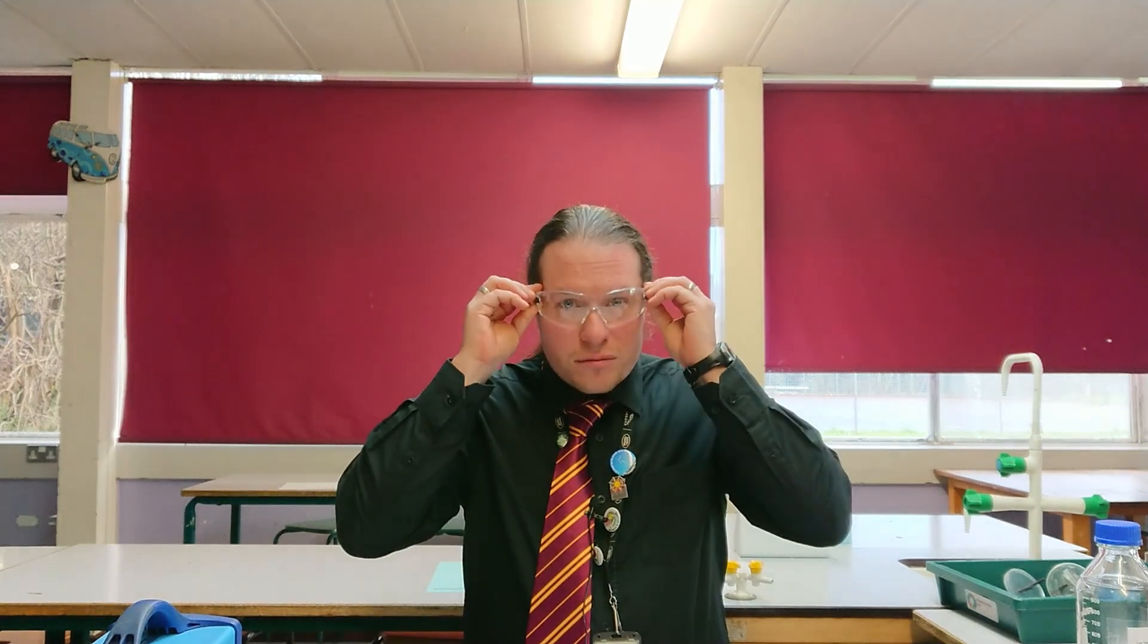Hey everyone, welcome to Grade Game where every student can make progress. We're going to be looking at another required practical today, a chemistry one. Don't forget, safety first - gotta wear your safety specs.